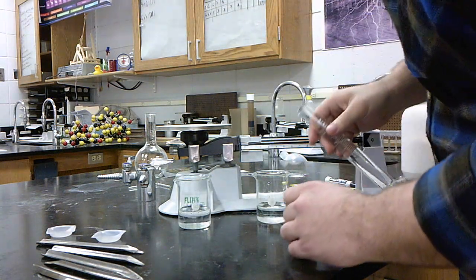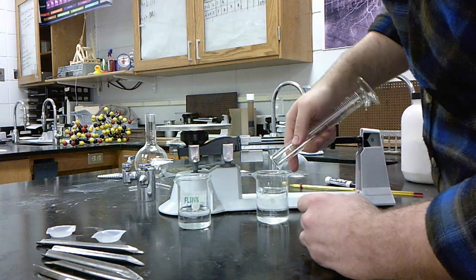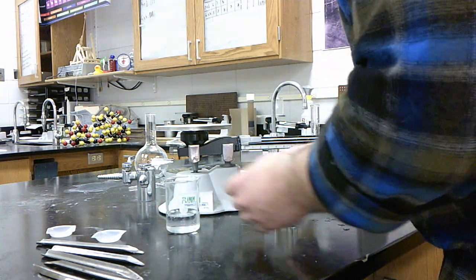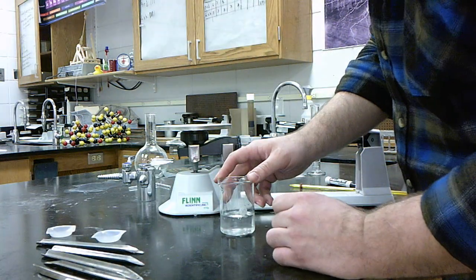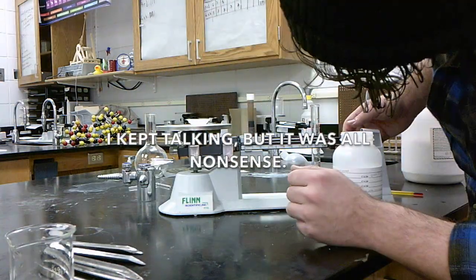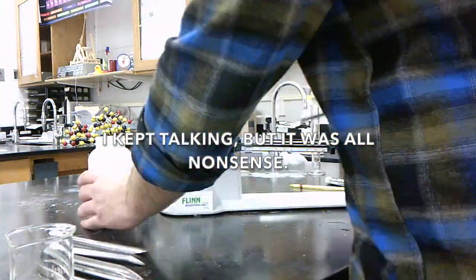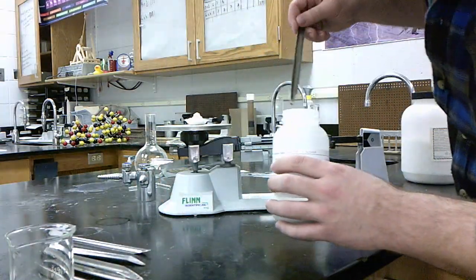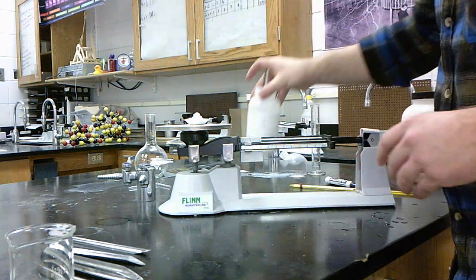It doesn't really have to be that exact. I just got lucky with it. Okay, so there's 50, there's 100. My ammonium nitrate is going to go into the 50 milliliters. So let's get some of that measured out. There we go. Good, 10 grams.